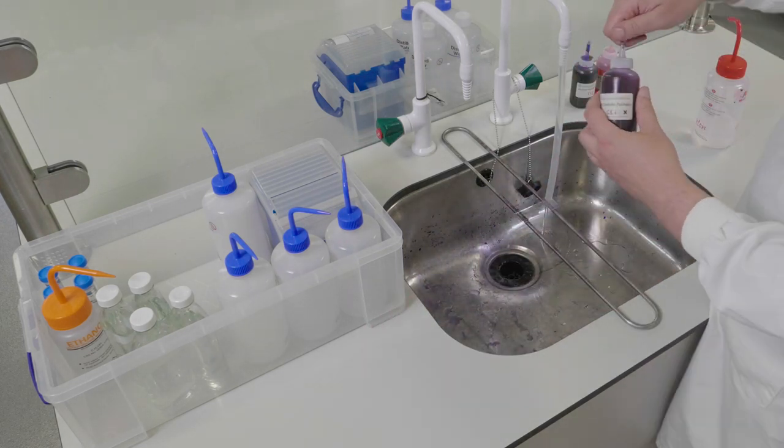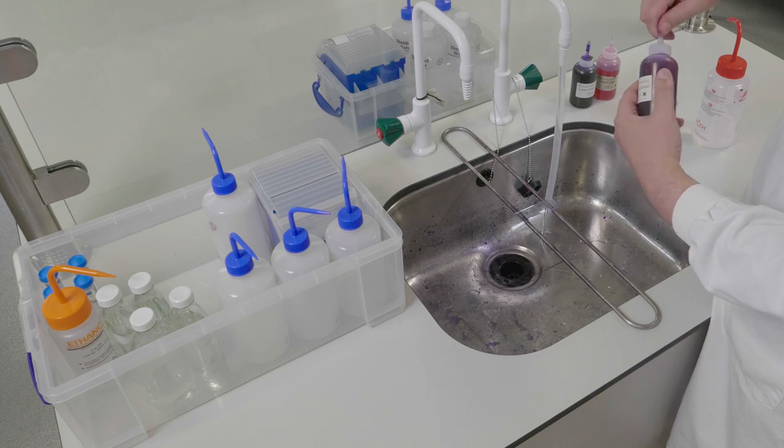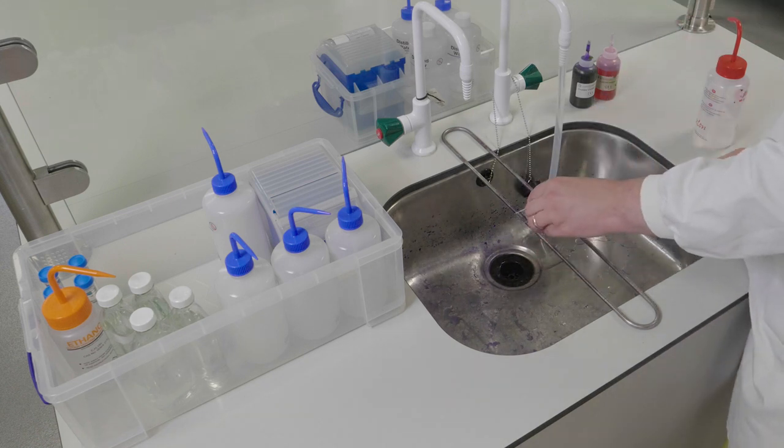Finally, add carbol fuchsin to your slide. Leave this on the slide for one to two minutes before washing it off.